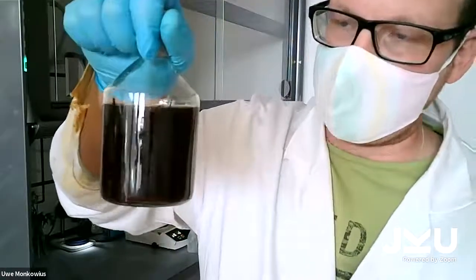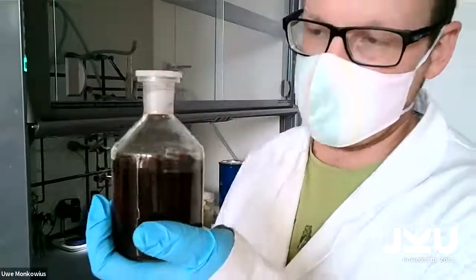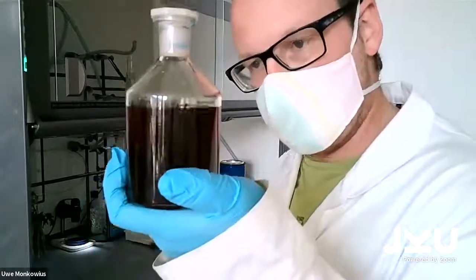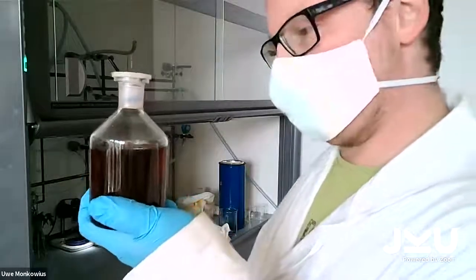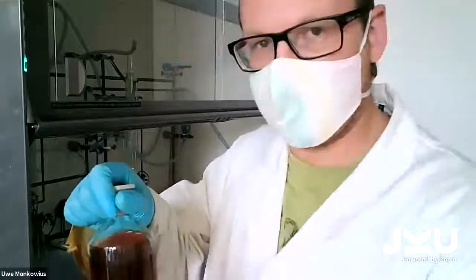And the funny thing about that experiment is that I cannot do it once or twice, I can do it a few times. So you see the bottle is already getting lighter and lighter red. Starting to sweat here, not used to doing so much work.